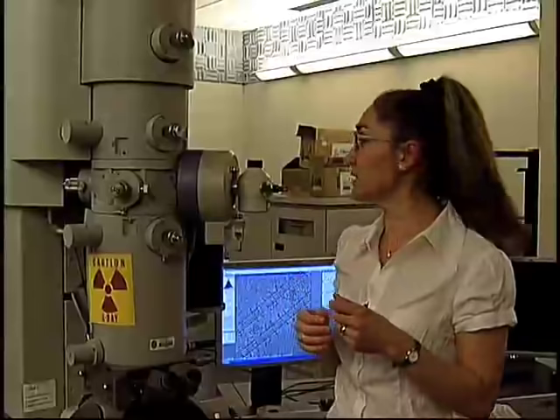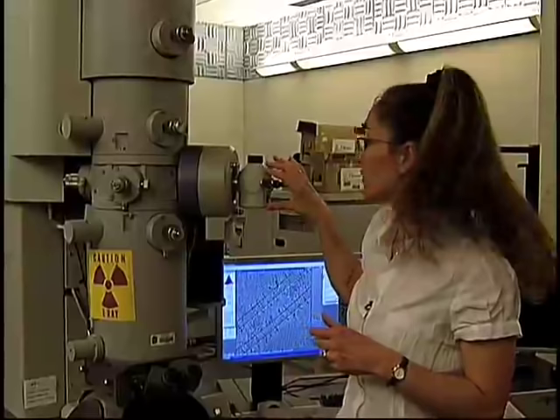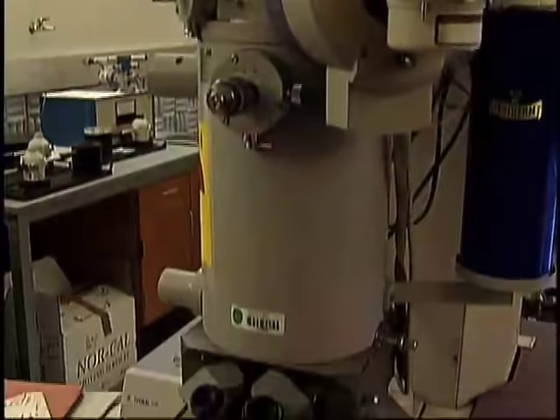The objective lens will combine the scattered and non-scattered electrons to give you contrast in the image, and that's also where the sample goes in. In this case, this is a cryo-sample being maintained at liquid nitrogen temperature by being in contact with a Dewar with liquid nitrogen. After the objective lens come a number of intermediate lenses that are utilized to change the magnification from 50 times to something as high as 400,000 times. The image can then be observed on a phosphor screen, directly on a TV, and ultimately recorded for further data processing, either on photographic film or on a CCD camera.